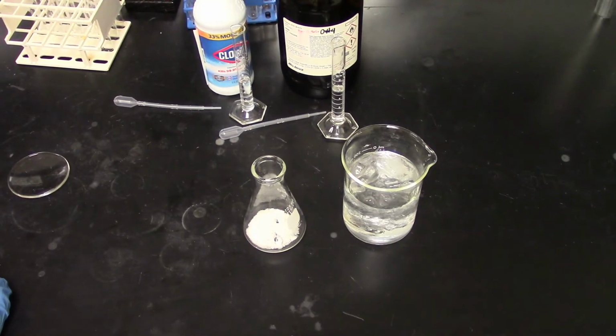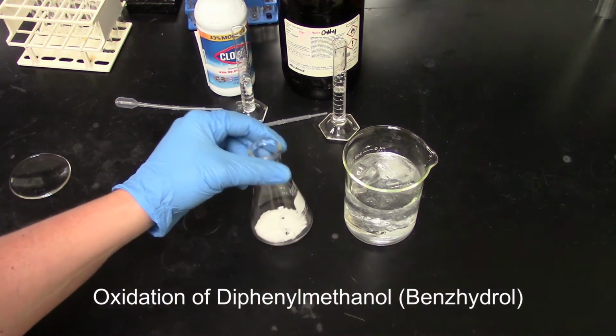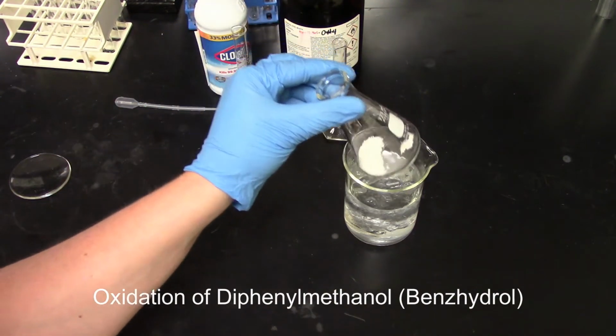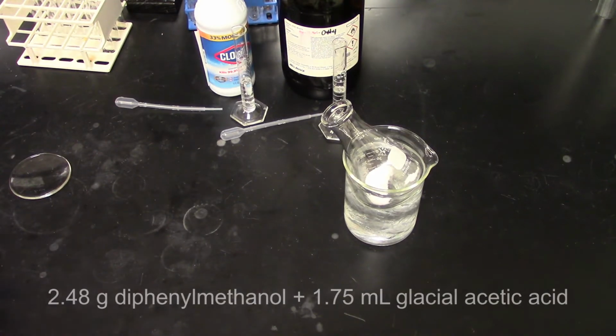Let's talk about the oxidation of diphenylmethanol, or benzhydrol. To start this out, we've weighed out 2.48 grams of our solid, and we're going to add in 1.75 mLs of glacial acetic acid.